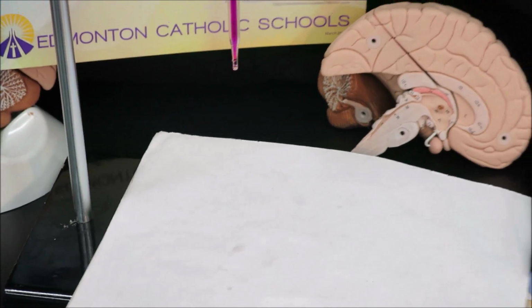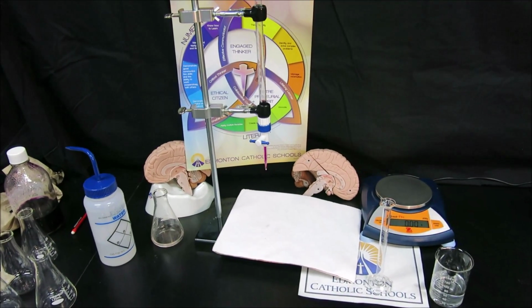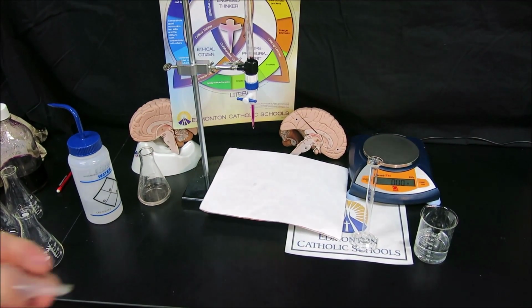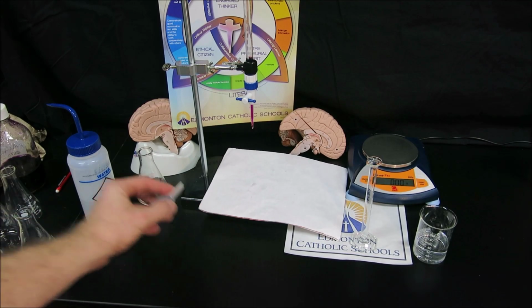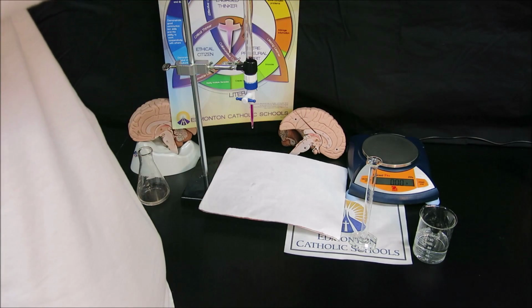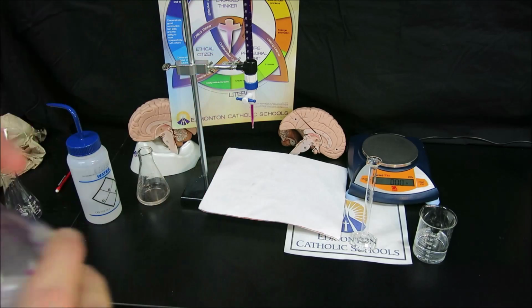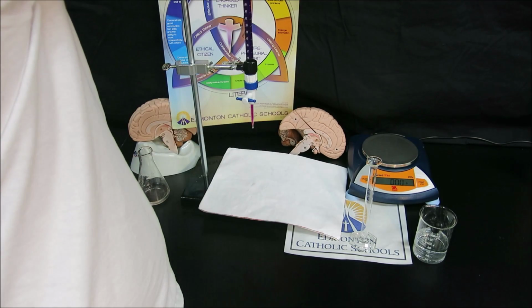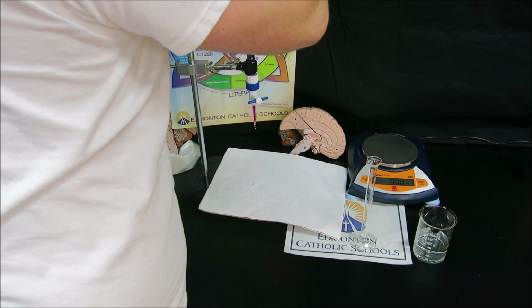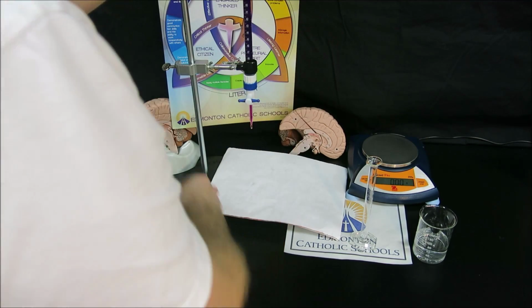Our burette must be filled because to do our next titration, our burette has to be topped up because we don't know the volume required for the titration of the peroxide. So again, we'll use our small little burette funnel. And if you're tall enough that you can fill the burette as it is in the stand, that simplifies taking the burette off. Again, not important to go to zero. So in this case here, we have our burette volume to be at 6.5 milliliters.